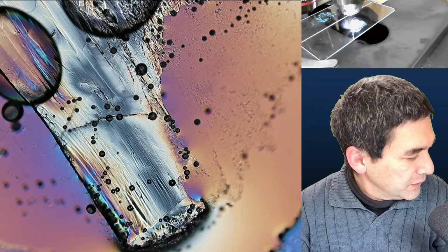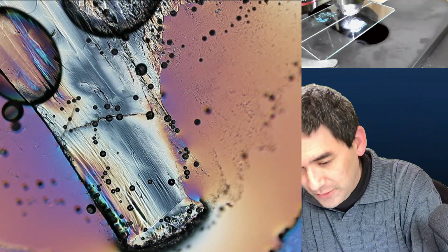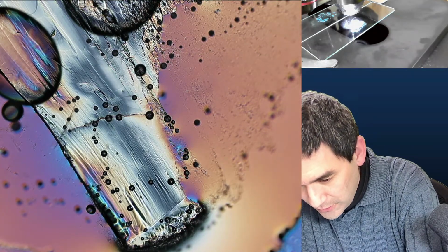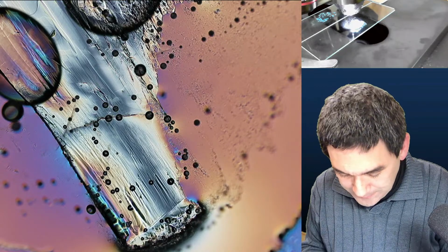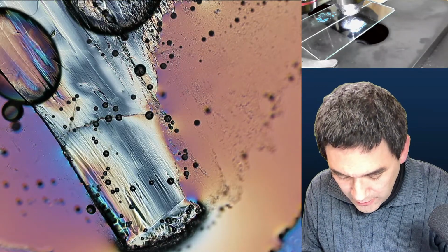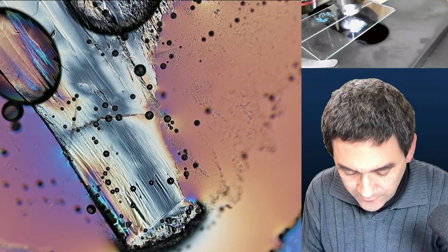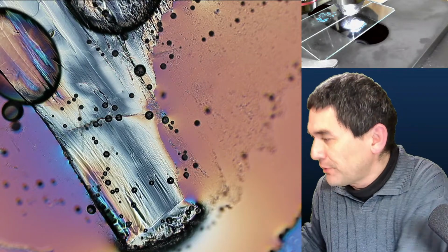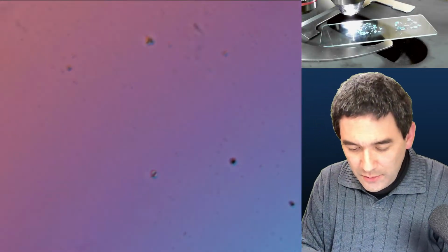So what is number 4? Citric acid. This was also difficult. Citric acid is readily available. Unfortunately, I got some water spilled here, and I also want to show you a little trick for how you can improve the chance of citric acid forming crystals. It takes a long time, but the citric acid crystals also generally make very nice patterns. Many of you probably already know it, because it can also be used in cooking, for example. It's very, very sour.